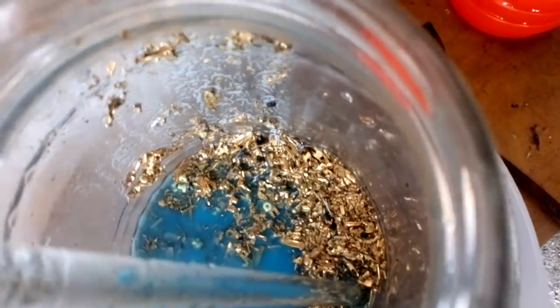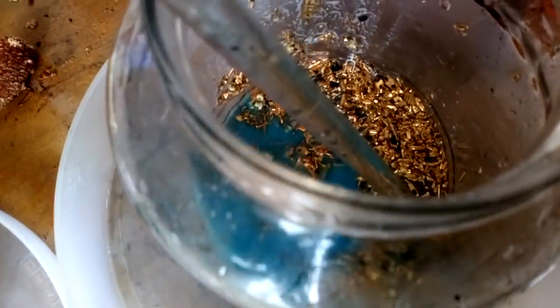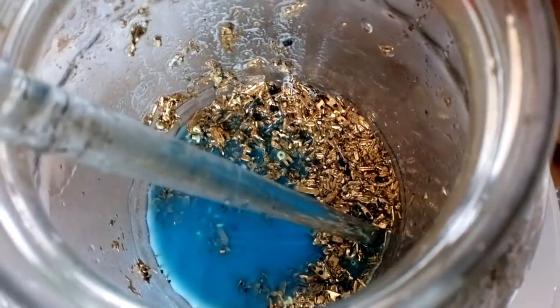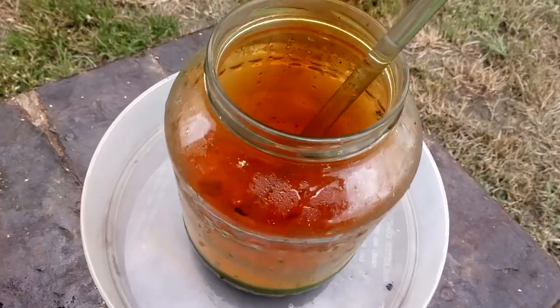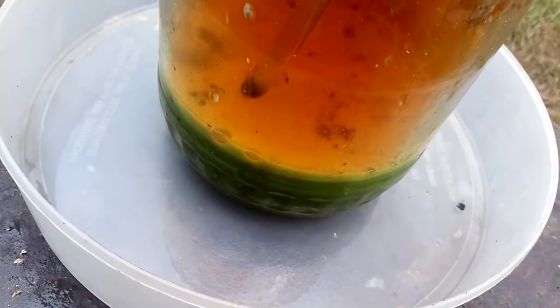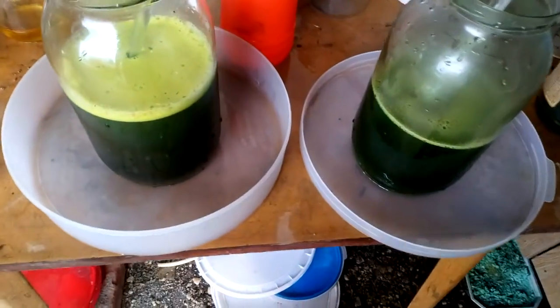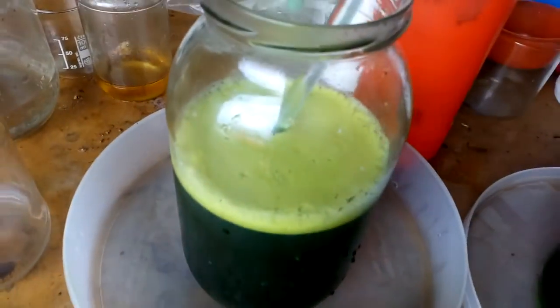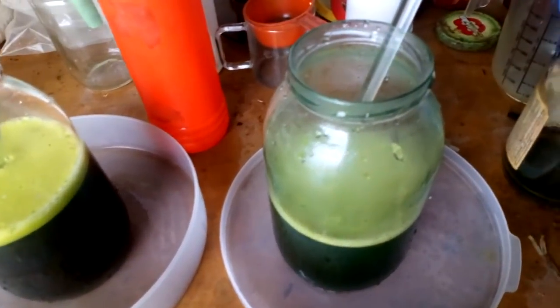There are our foils. Now we got nitric acid inside — pre-nitric — so now we're gonna just add warm hydrochloric acid and I think that will be enough. This is our foils solution. Now I put some urea, then SMB. After we neutralize, we will drop some gold.